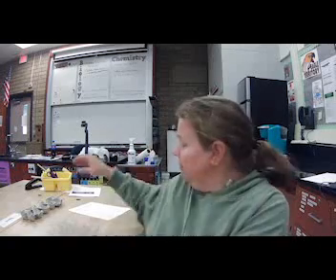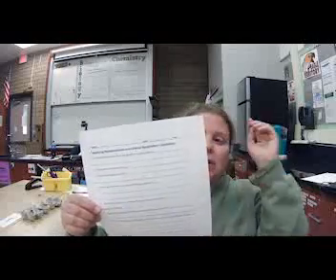Welcome to our Modeling Photosynthesis and Cellular Respiration Lab. So I'm going to run through this lab. You should have your questions open, so make sure that you have this open. This is your Modeling Photosynthesis and Cellular Respiration questions. You need to be answering these as I'm doing the lab, and then this will go into your notebook.